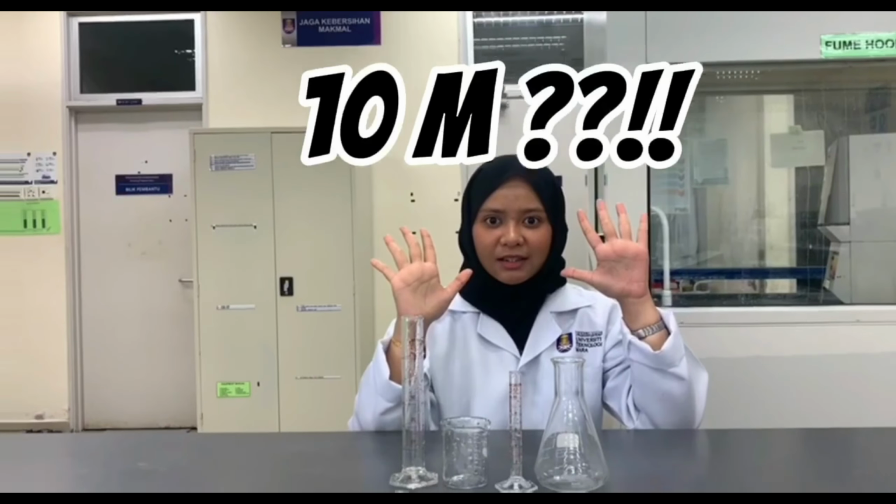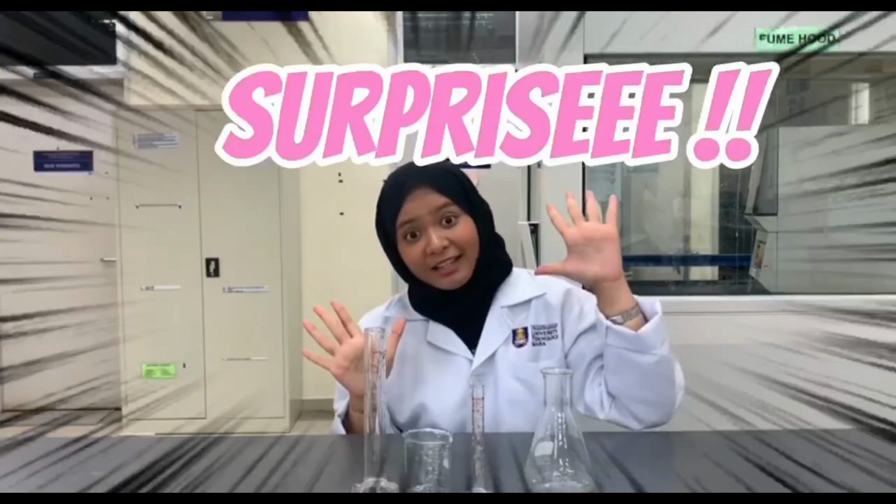Next, we have the volumetric glassware. Sounds fancy because it is. These things are not your average water bottle, okay? You mess up the volume and suddenly your 0.1 molar solution is giving 10 molar personality. One extra drop and the whole solution's like surprise! I'm too concentrated now. Love that for me. Moral of the story? In a pharmacy lab, we don't guess. We don't eyeball. We measure like our lives depend on it, because sometimes they kinda do.